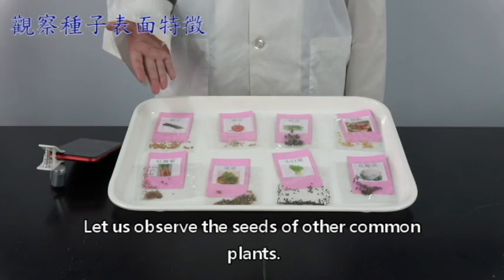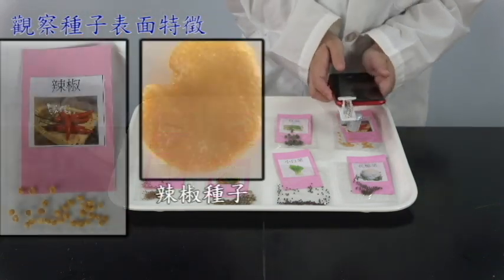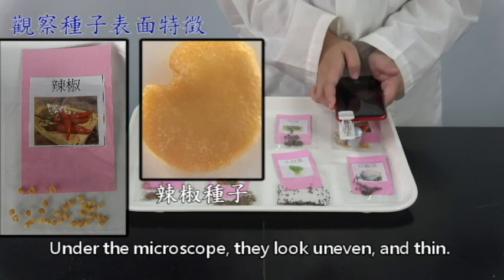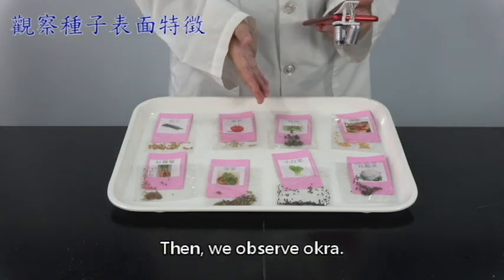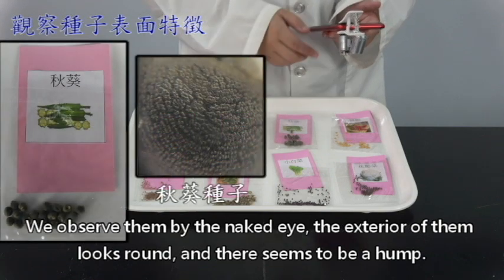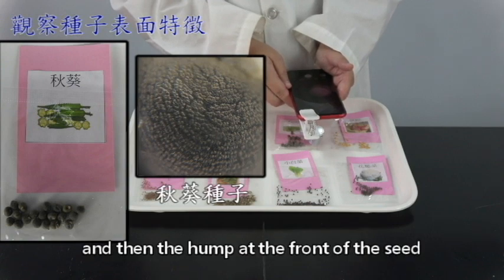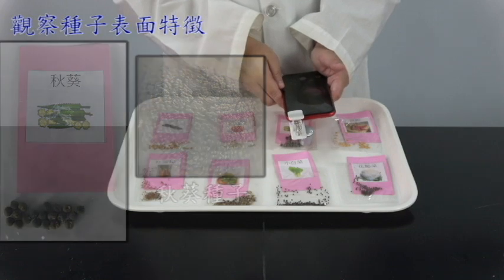Let us observe the seeds of other common plants. First, let us observe the chili. For chili, its seeds are yellow. Under the microscope, they look uneven and thin. Then we observe okra. We observe them by the naked eye. The exterior of them looks round and there seems to be a hump. Under the microscope, the white part of the exterior is uneven, and then the hump at the front of the seed can be seen more clearly.